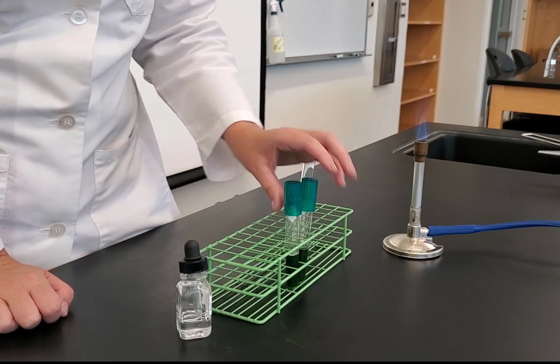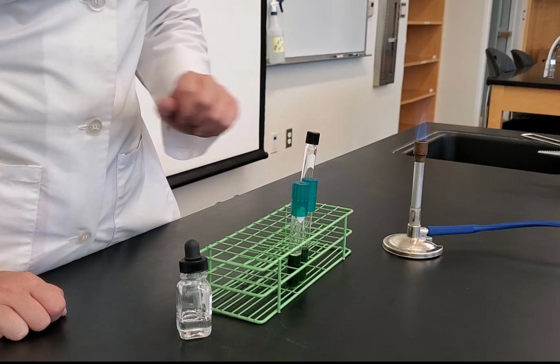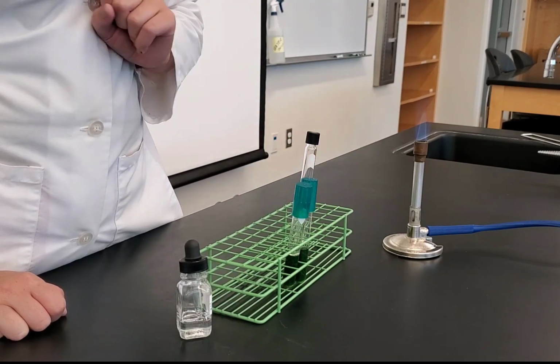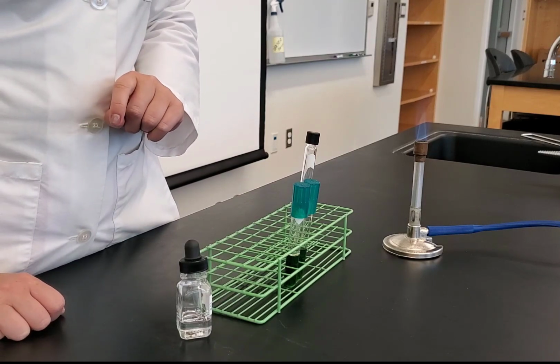I will inoculate in pairs. So for each organism, I will inoculate into 2 tubes. And then for one of the 2 tubes, I'm going to add the mineral oil. That's testing my fermentation. And I have my 1 tube without my mineral oil. That's testing for oxidation. And so this is the setup for my OF test.